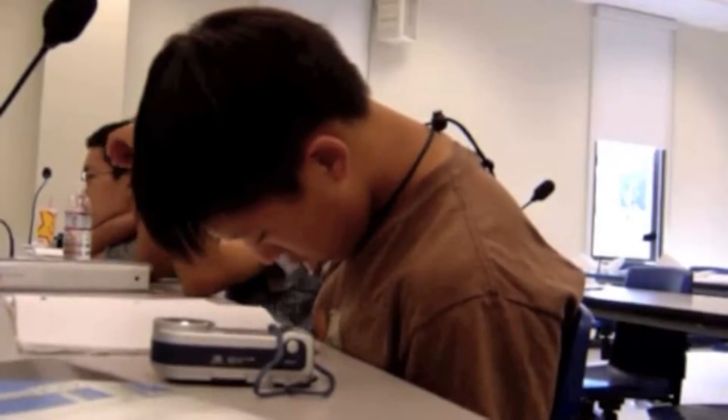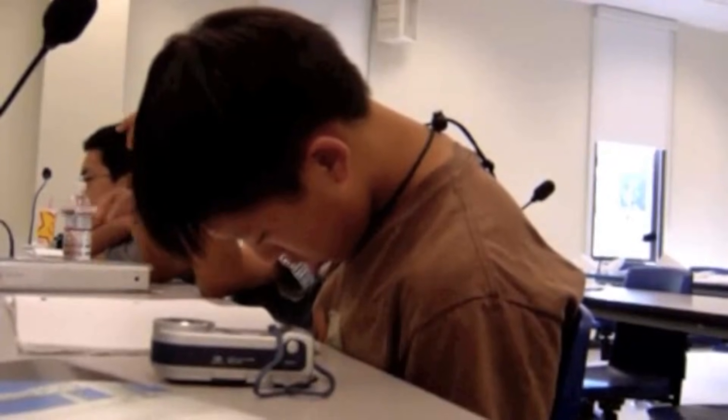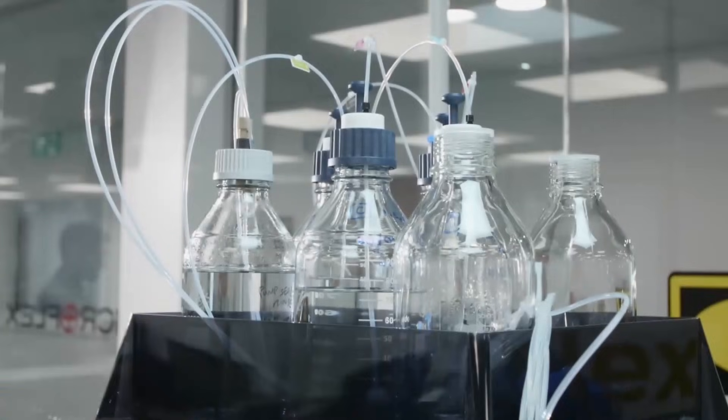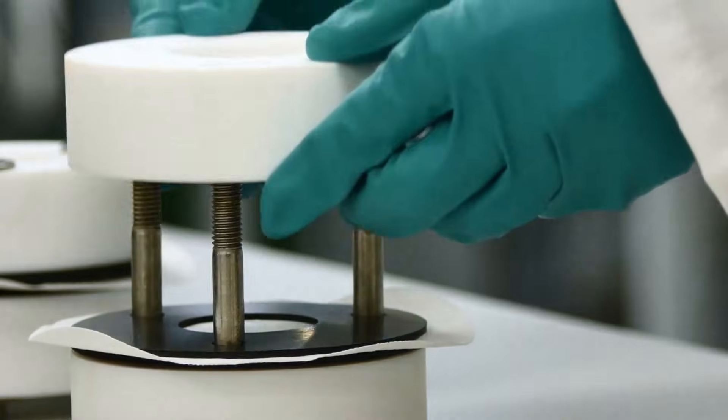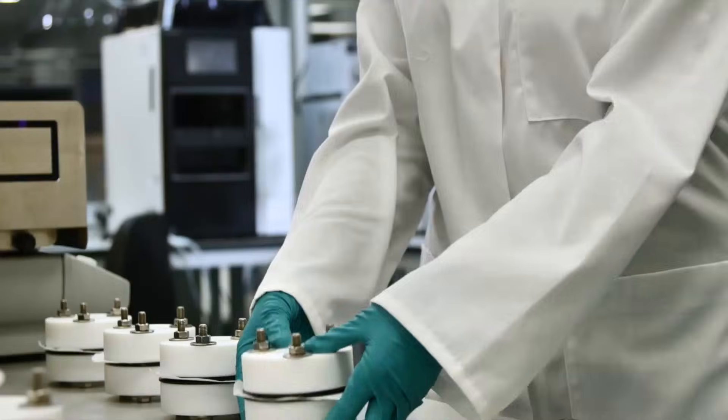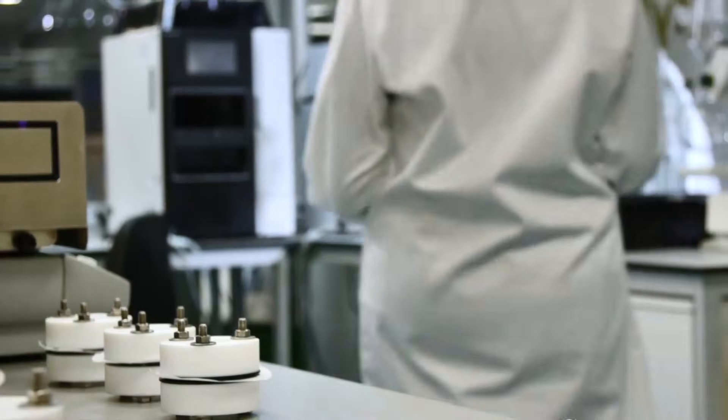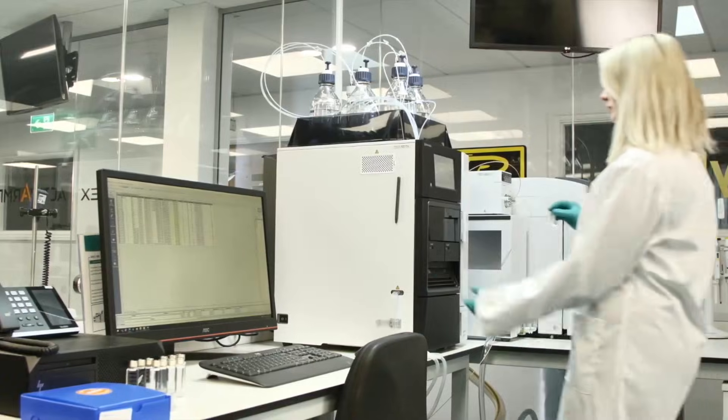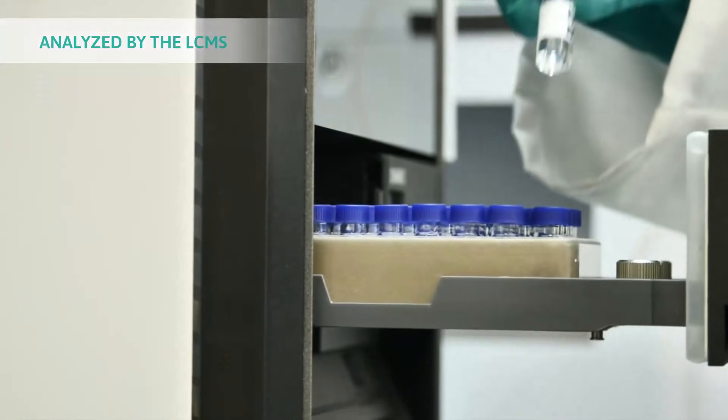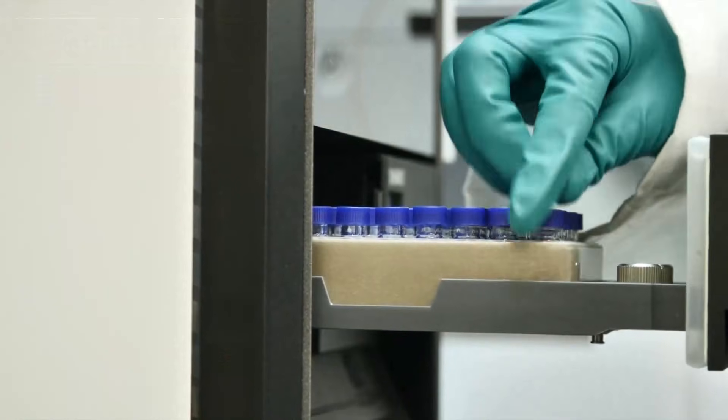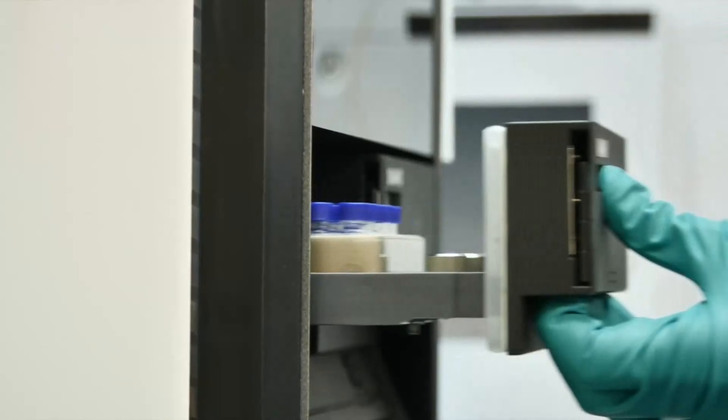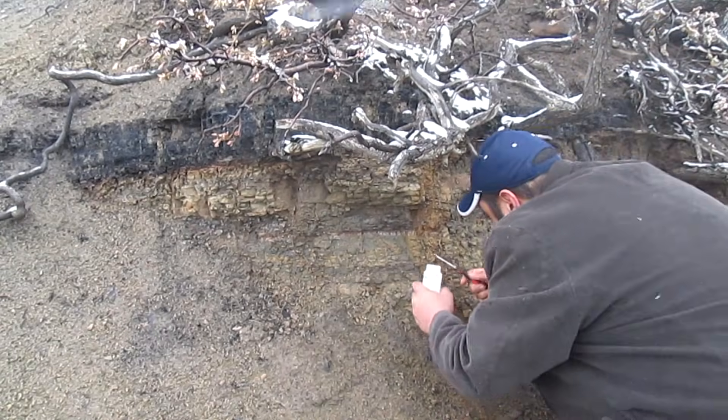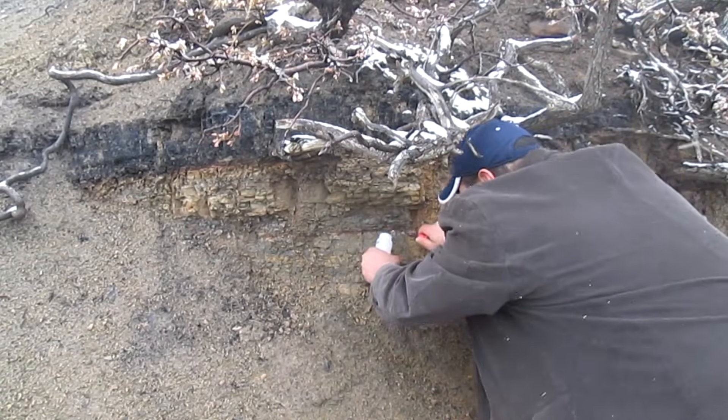Back in college, I did not always pay attention in organic chemistry class, so I'm not exactly sure how I can benefit from this machine, mostly used for peptides and huge molecules like proteins. But the inner workings might be good enough for some interesting experiments in isotopic separation and inorganic stuff.